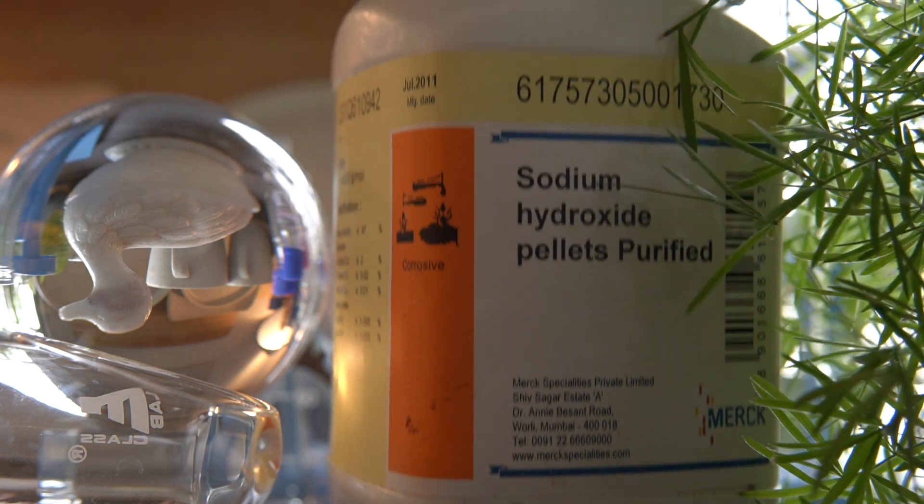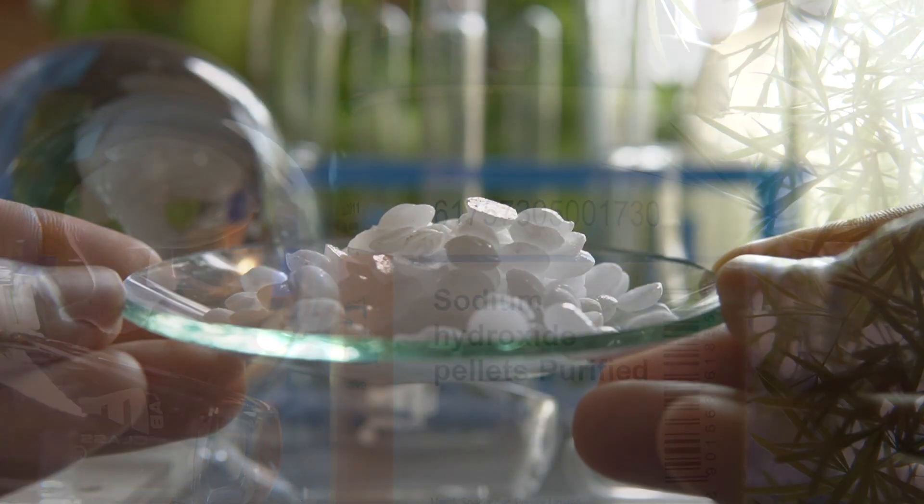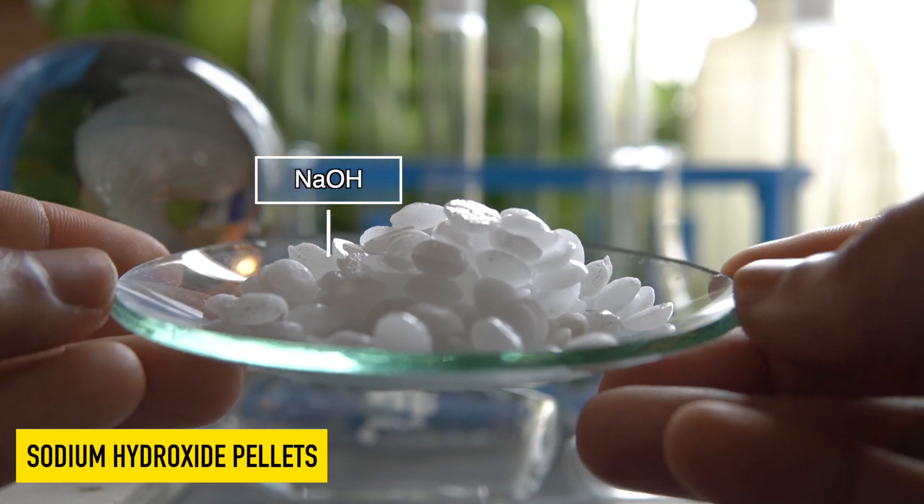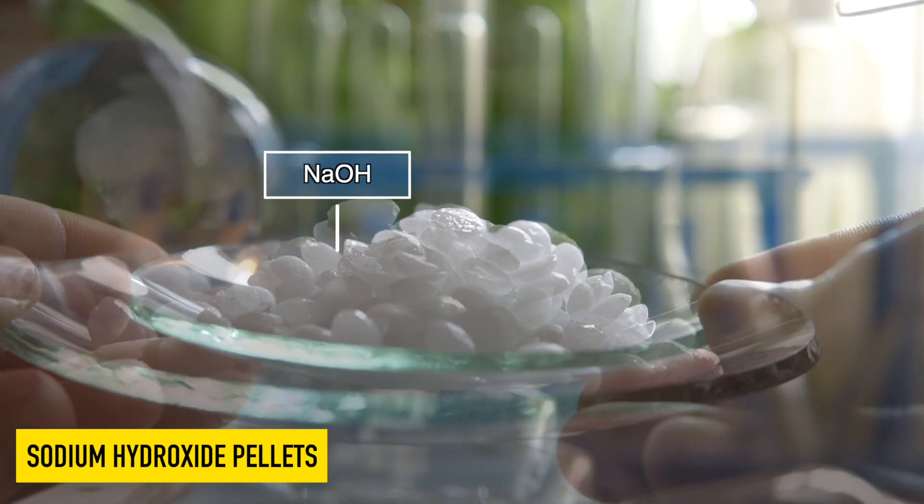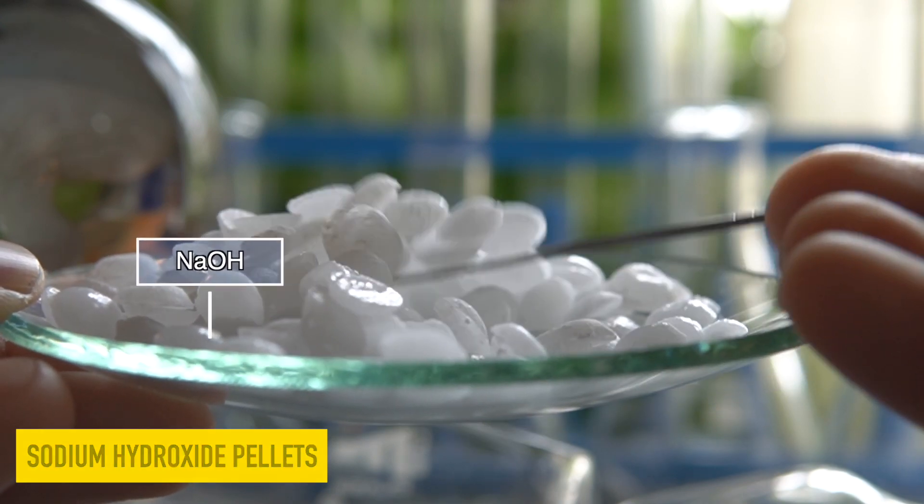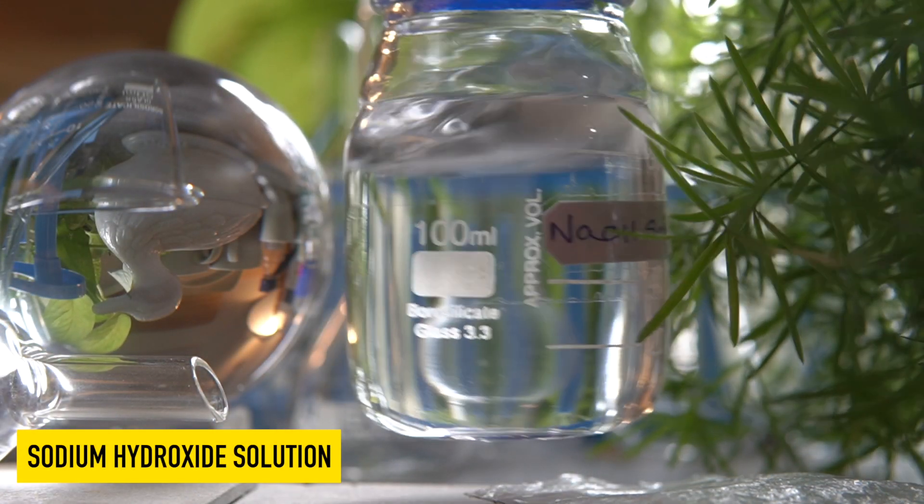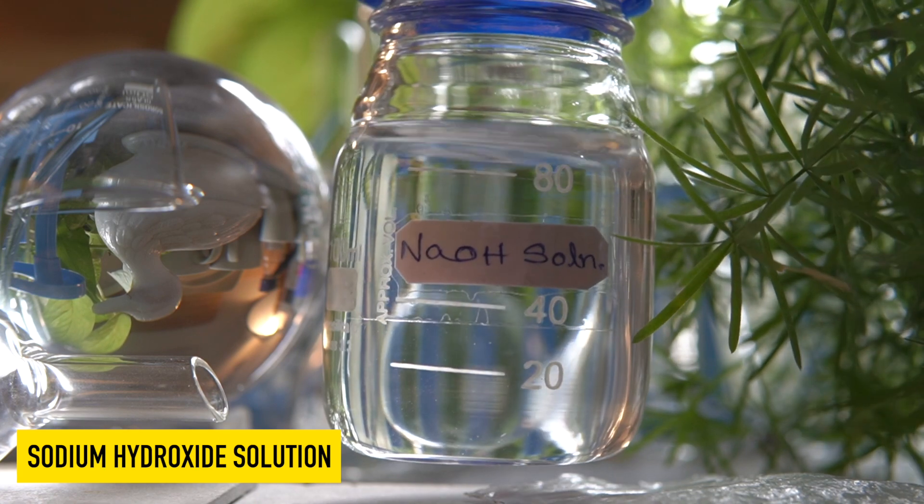This is sodium hydroxide. It comes in the form of pellets. Solid sodium hydroxide is a hygroscopic substance. It means that it can absorb moisture from air. It can easily dissolve in water to make a homogeneous solution.